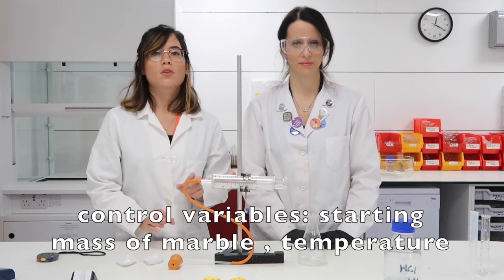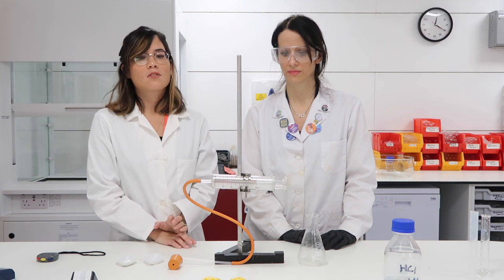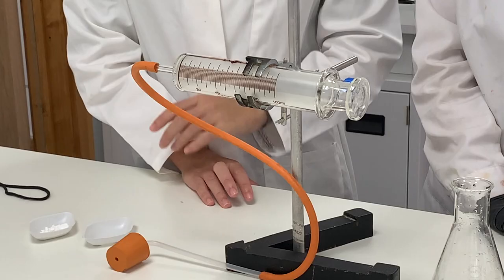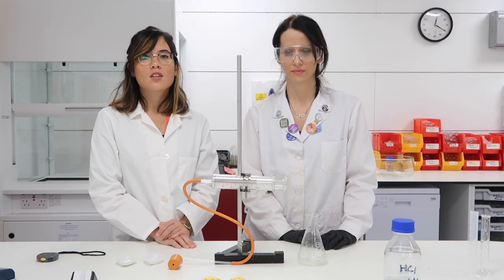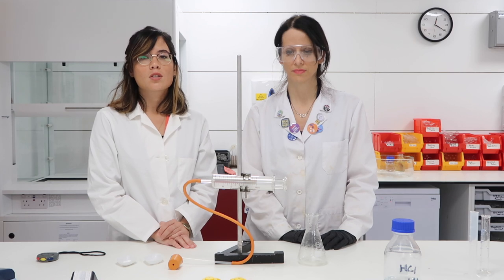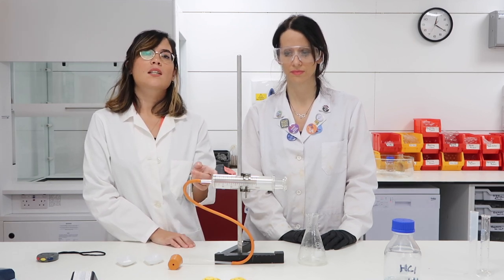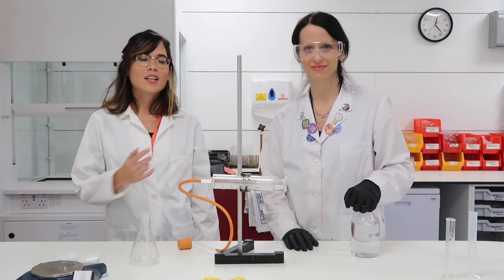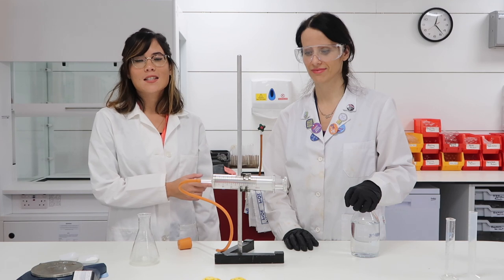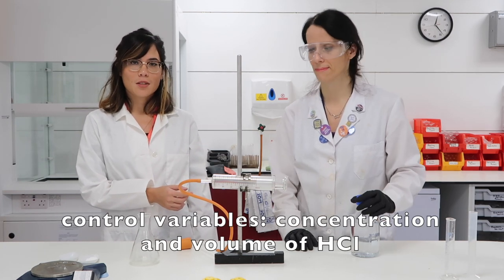We also need to try to control the temperature. We're going to measure the rate of reaction by looking at how quickly carbon dioxide is produced, because if you react calcium carbonate with hydrochloric acid you produce calcium chloride plus water plus the carbon dioxide that we measure. One final control variable: keeping the concentration of acid the same — we're going to be using 0.5 molar in both experiments.